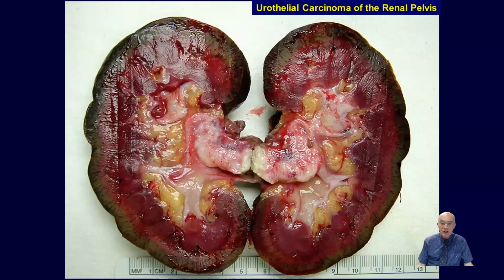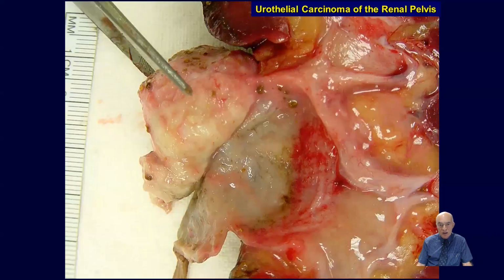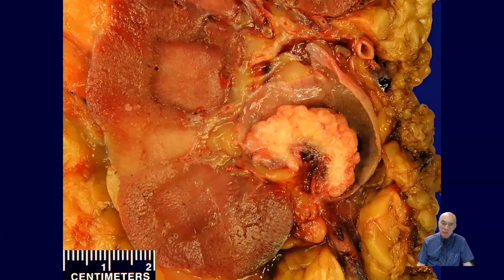Here is a typical tumor in the pelvis, as you can see, that is molding the shape of the pelvis. Apparently, it's not really involving areas further from the pelvis. In this case, with this forceps, we have lifted this area of the tumor to see the implantation, and this particular case didn't have invasion into the subepithelial tissue or the renal parenchyma.